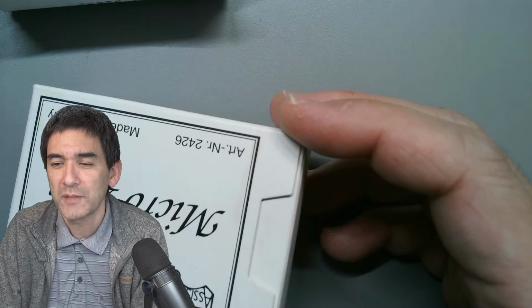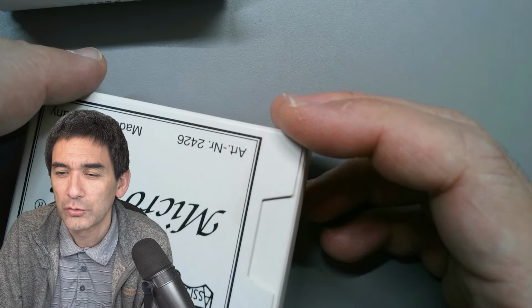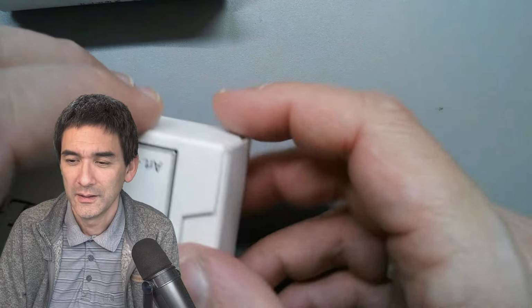Yes, interesting. Trust me, we've been doing it on Twitch for a few weeks. Just a single drop of moss and leave it to see what happens. Sometimes it's exciting. Sometimes it's not. That's interesting. Okay. Yeah. The hope of being able to see something.